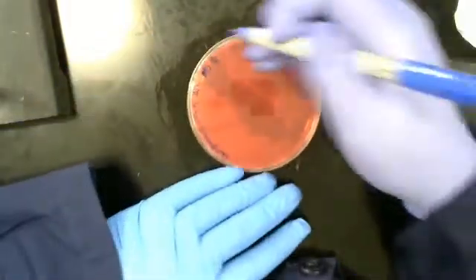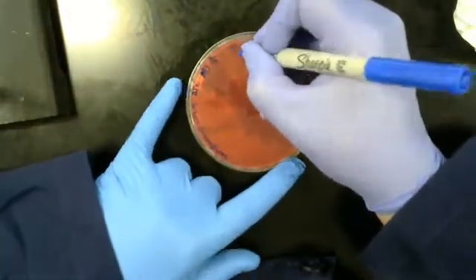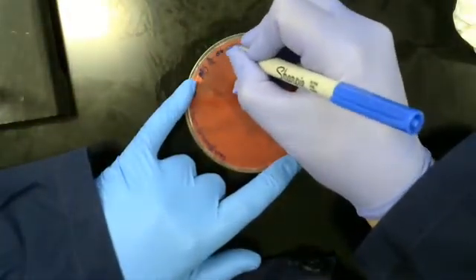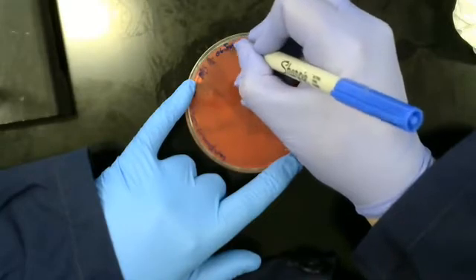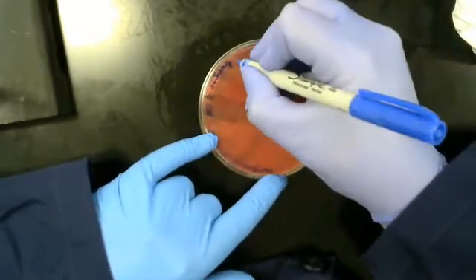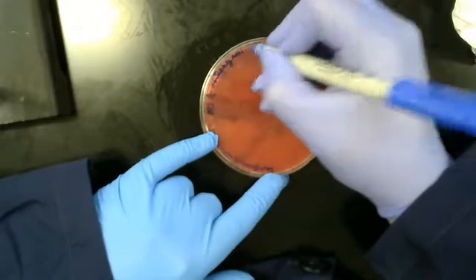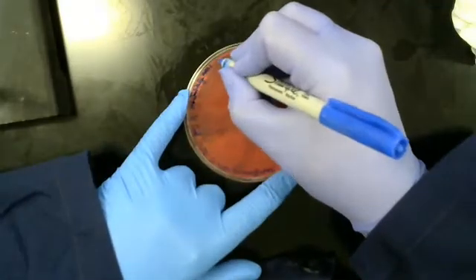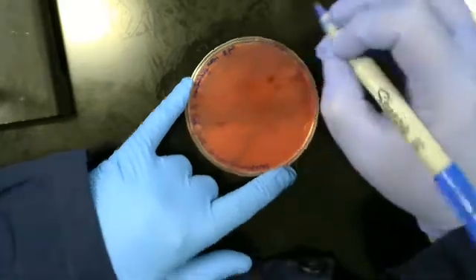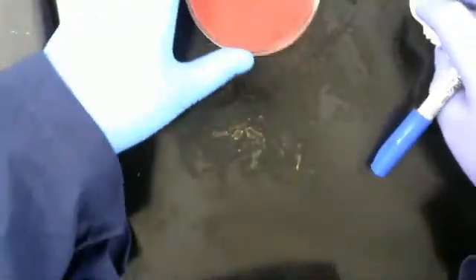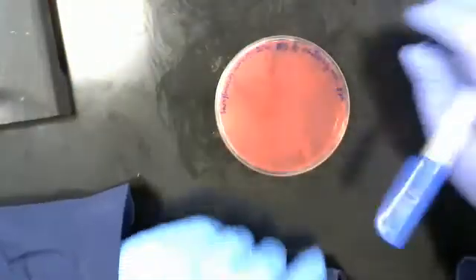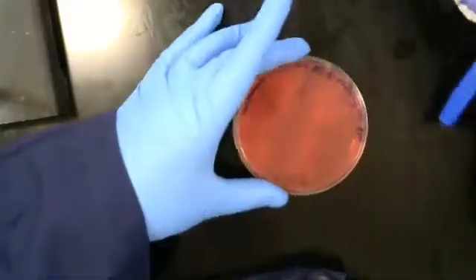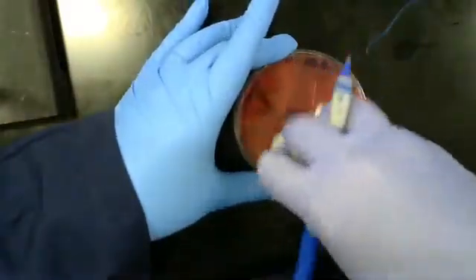Today's date. And here's a fully labeled plate. Let's break down exactly what's on a fully labeled plate.